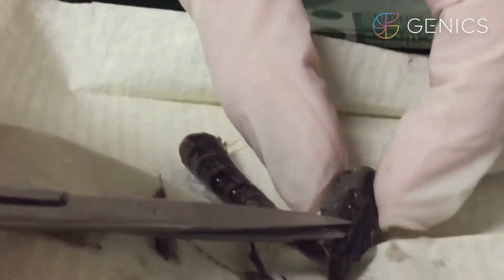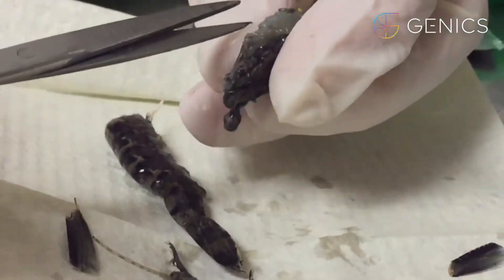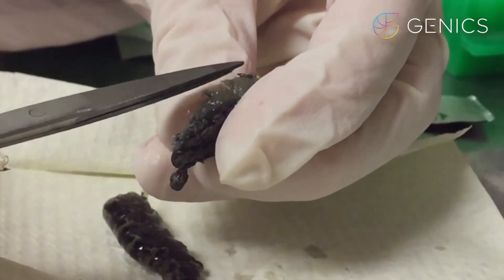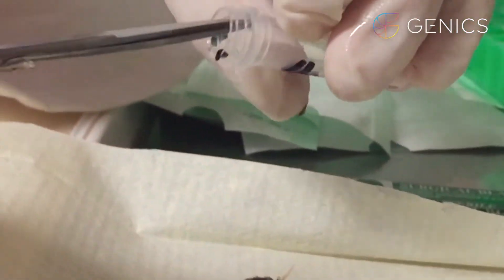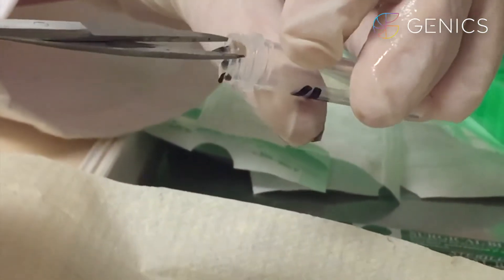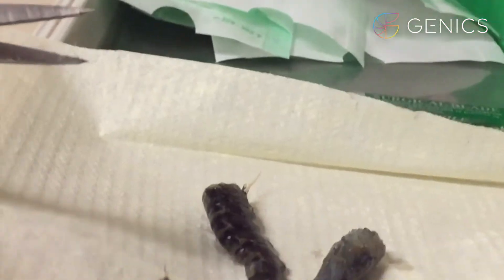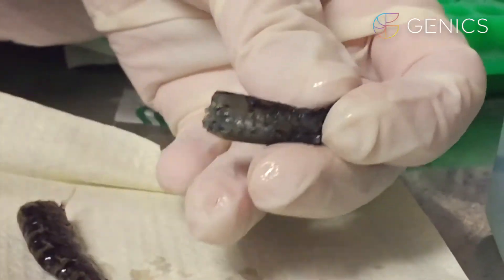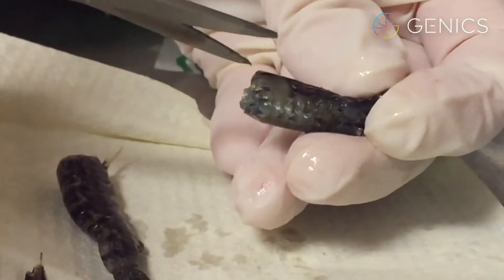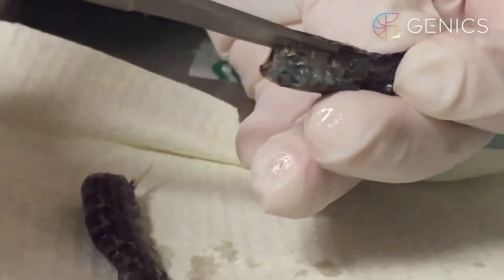The next tissue that we take are gills, and we snip off two gill filaments, which we're also going to put into the tube for pooled multipath testing. We are not going to take lymphoid organ or stomach in the case of this particular shrimp, because we want these in position for the deep-dive histopathology assessment.